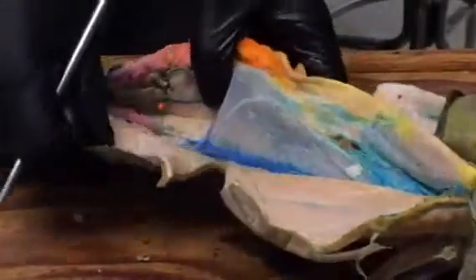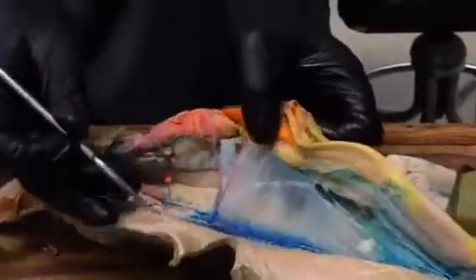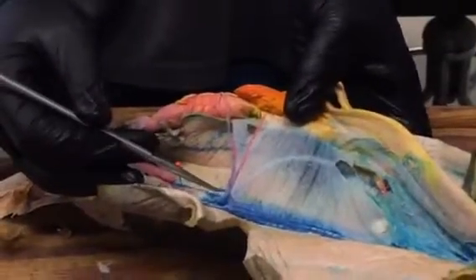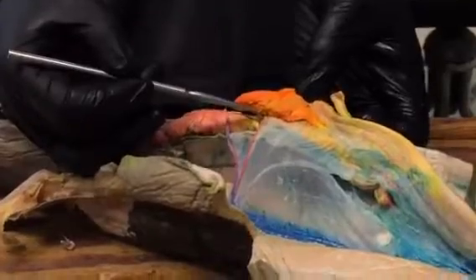Then there's the lienogastric and anterior mesenteric arteries. And these two come off the dorsal aorta very close to each other. The lienogastric you can distinguish because it's running to the region of the spleen. So that's the lienogastric there, and it supplies the spleen and the stomach as it passes through the spleen.